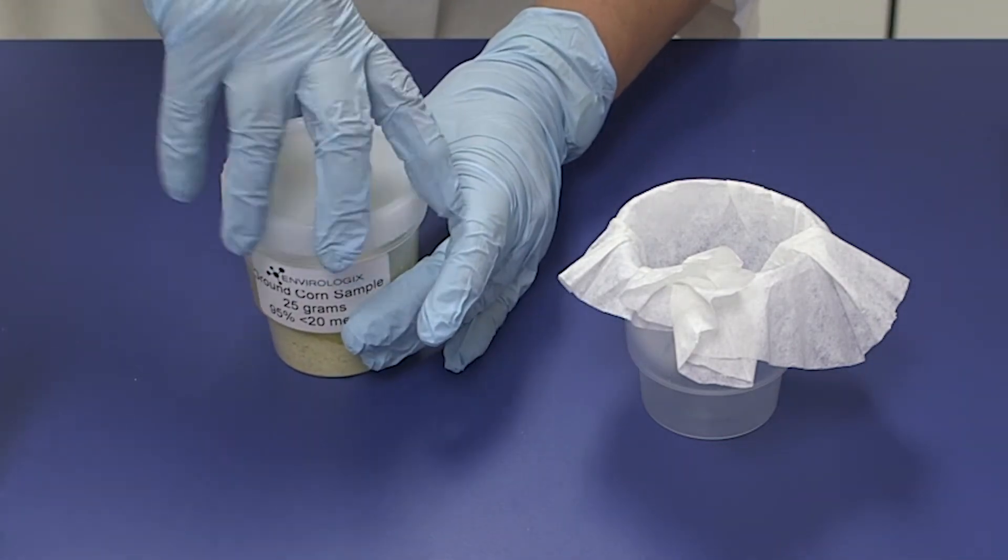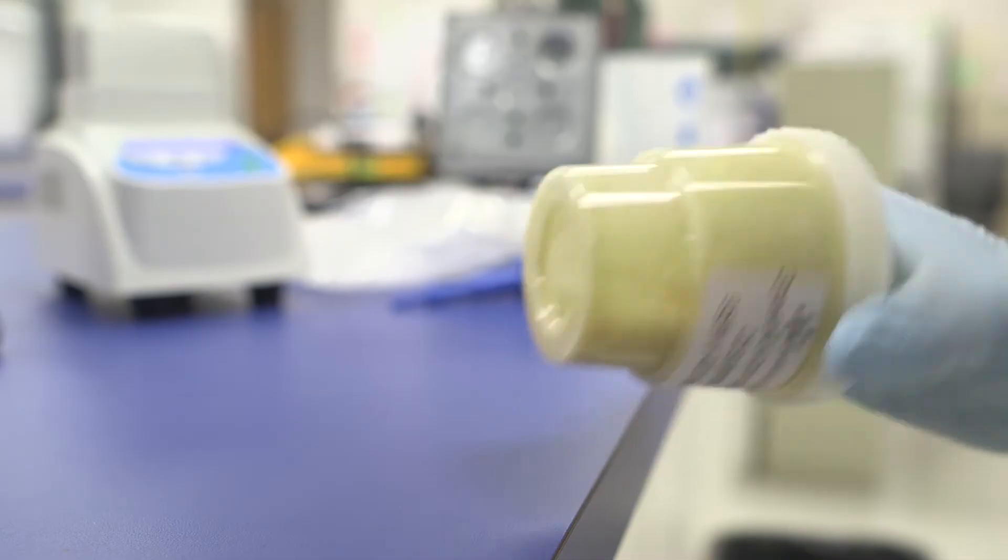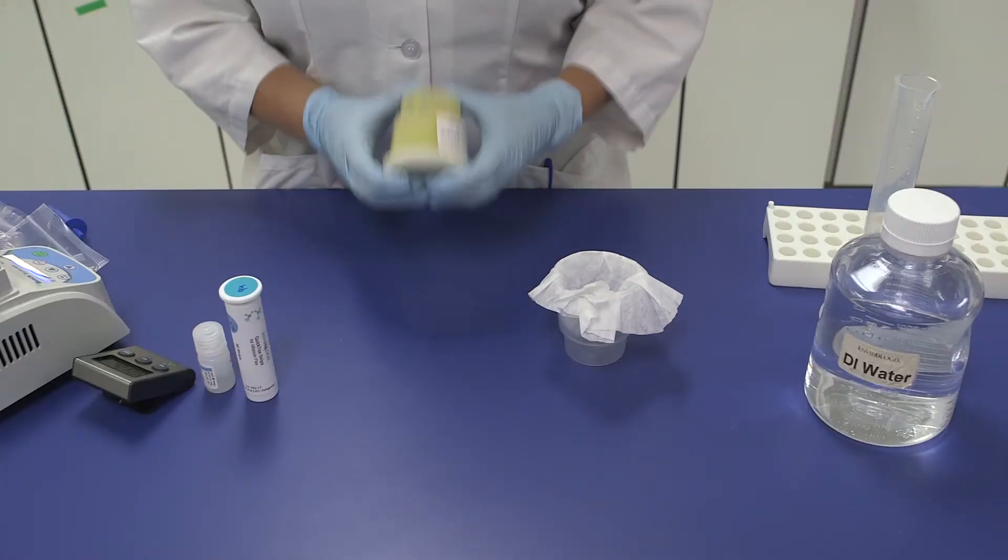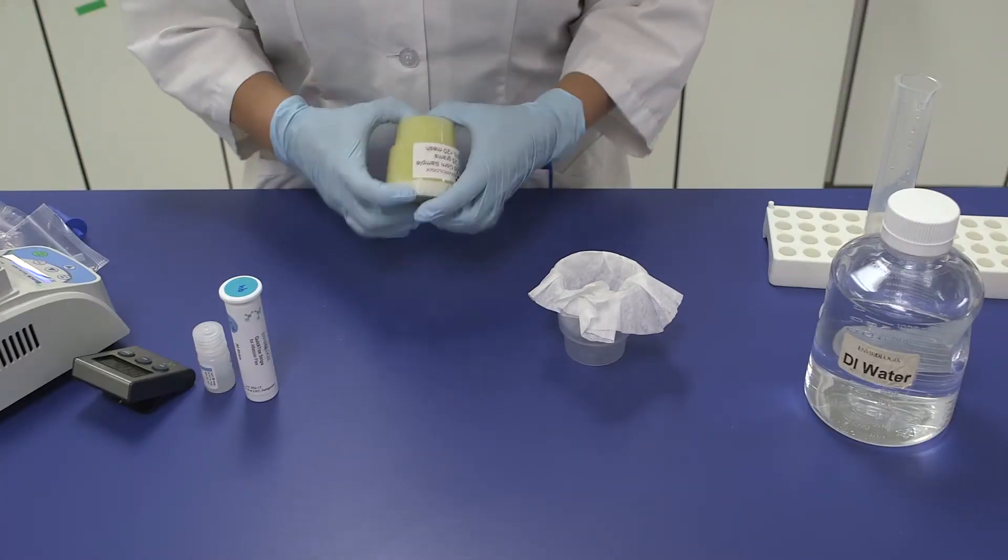Immediately seal and tap the container to thoroughly wet the sample. Without interruption, shake vigorously for 10 seconds by hand to ensure that the powdered extraction buffer can fully dissolve.